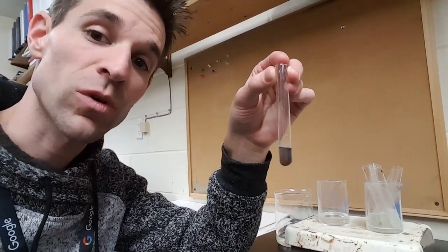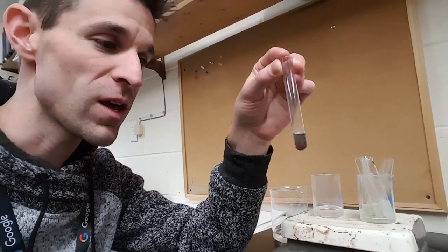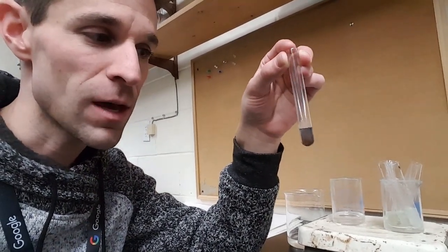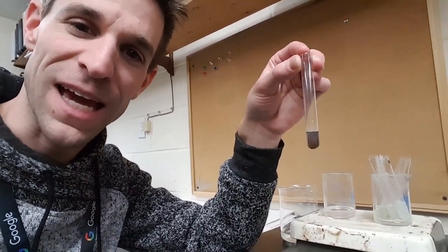So this is good evidence. This is the result we were looking for. And in class, we'll do some more tests next time to see if we can really prove that what we're pulling out of the banana cells is, in fact, deoxyribonucleic acid.